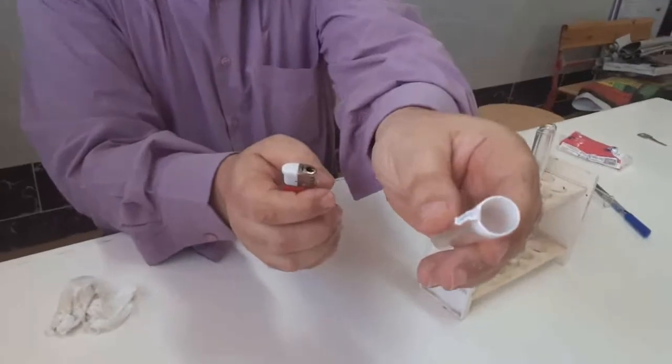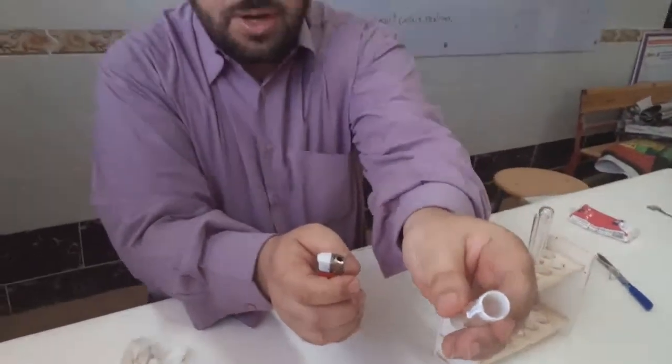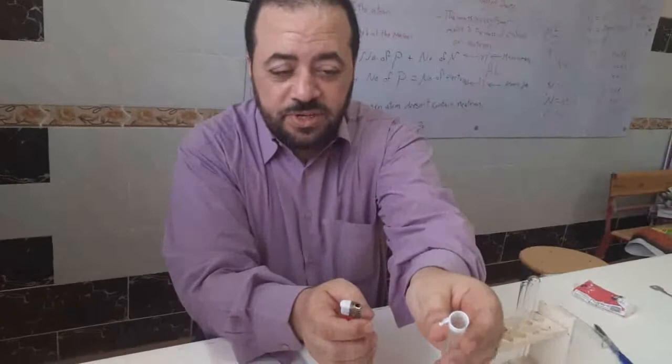It is the white powder of magnesium oxide, white powder on the walls of the test tube.